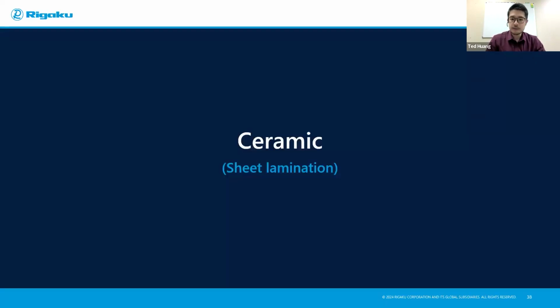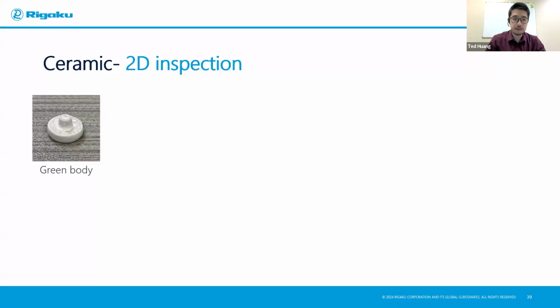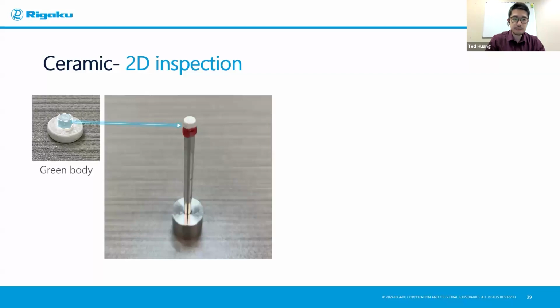The next example is for a ceramic 3D printed sample. It's made using sheet lamination. It was scanned using the same Nano 3DX. And in here, you can see this is the green body, meaning it just got sheet laminated together with some of the process. So how I image it is basically I cut the tip of it and mount it onto the pole here again. And the bottom is really made just to support it. So the key is really that tip.